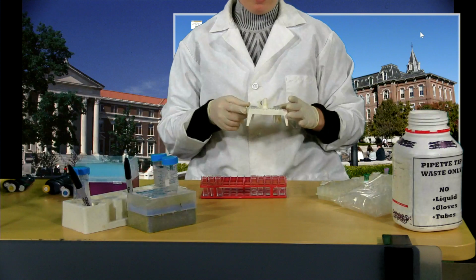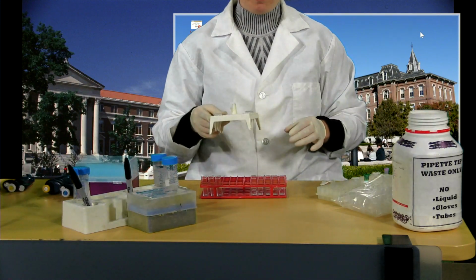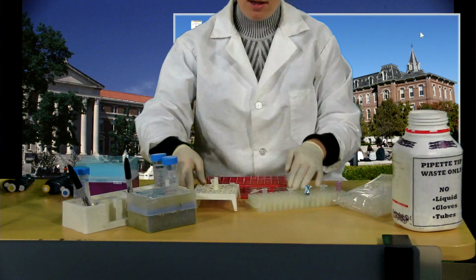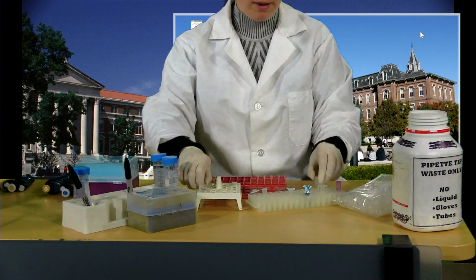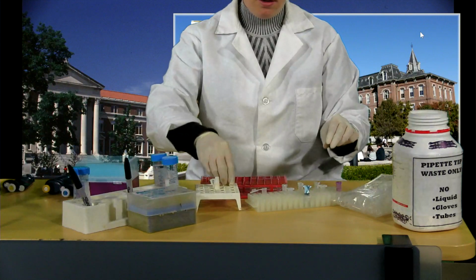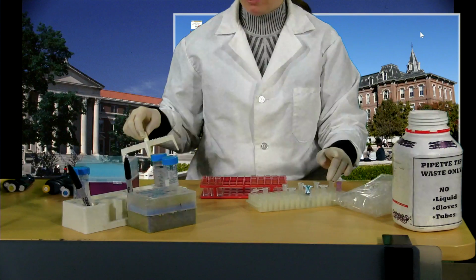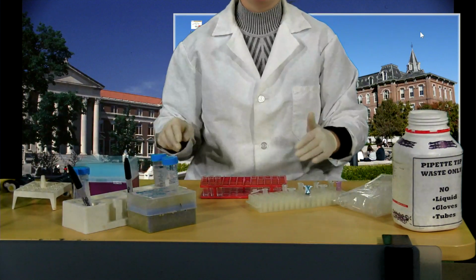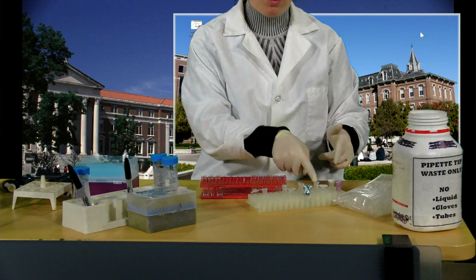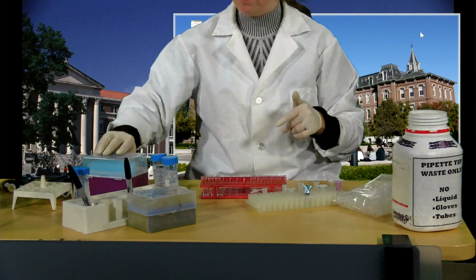Okay guys, so the 5 minutes has elapsed, and I've just removed my samples from the water bath. I actually took them out at around 4:45. I'm going to take them out of this floating water bath, put them back into my rack in the same order that they were in. The reason for this is that I want to pipette them out of the reaction tube and into the cuvette in the same order that I set up the reactions, because the delay between one and the others will be sort of mimicked in the delay here, and it should just minimize error.